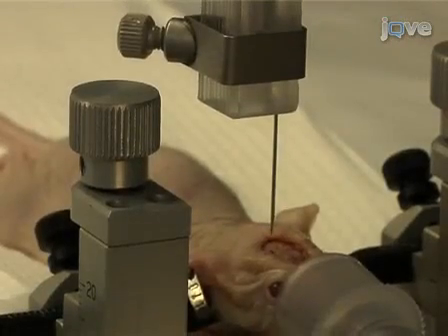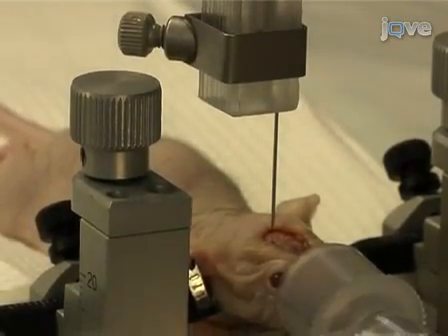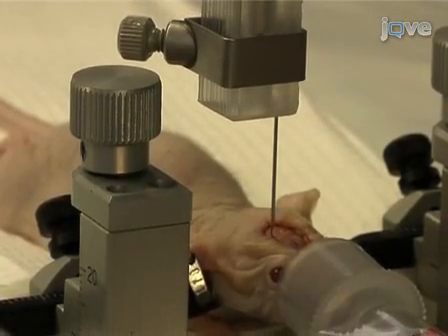So this next step is probably the most difficult aspect of the entire method. When placing the cannula, be sure to center it over the hole. To do this, check the cannula placement from all angles. Next, position the cannula over the skull hole and then lower 3 mm below the skull surface.